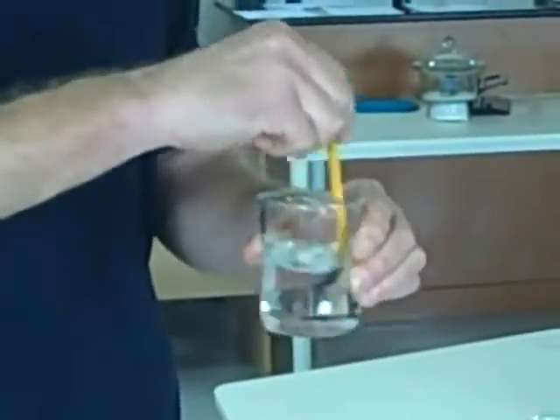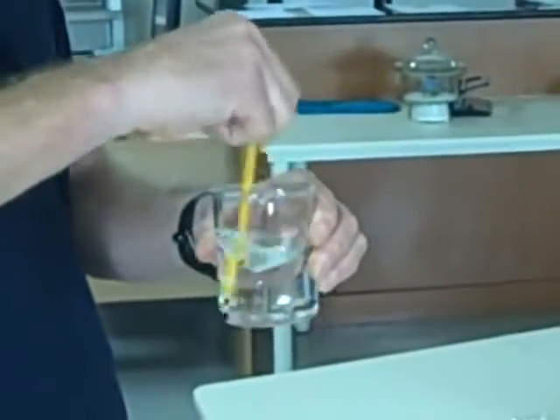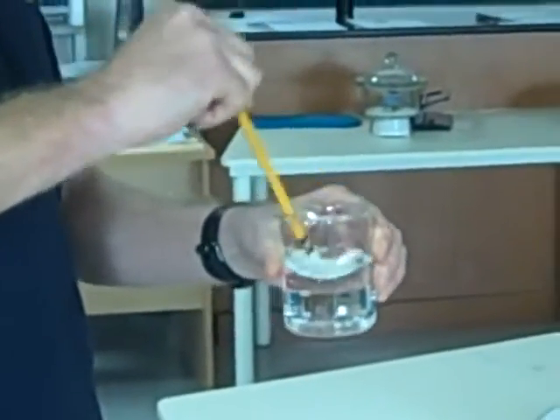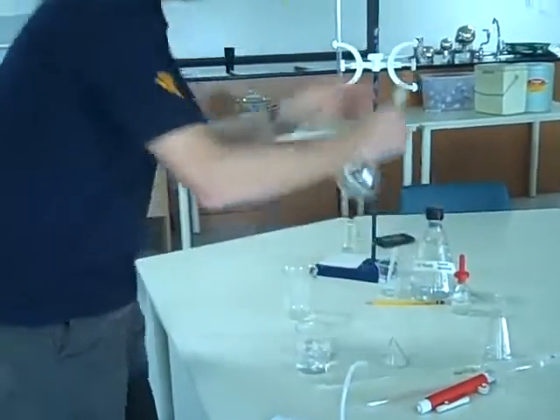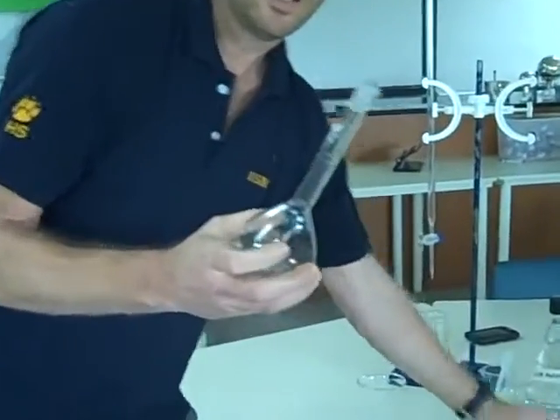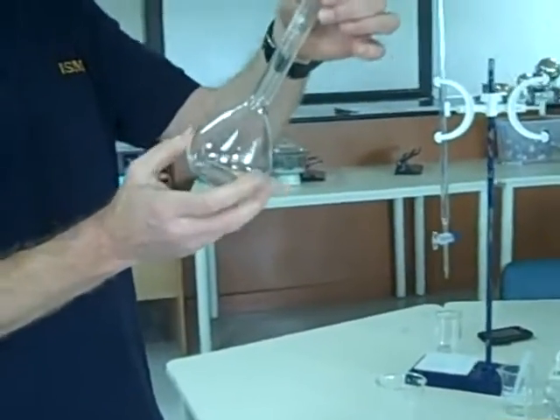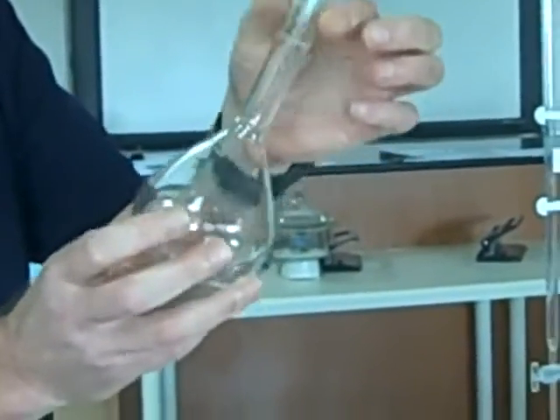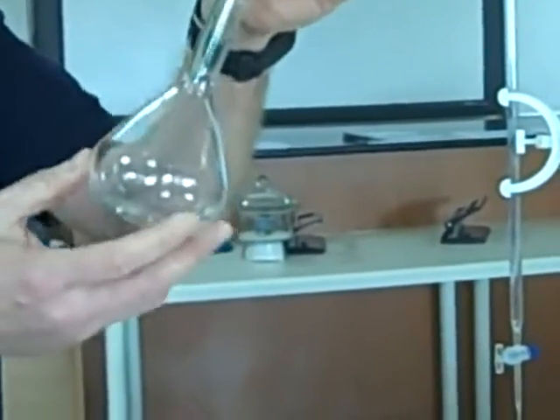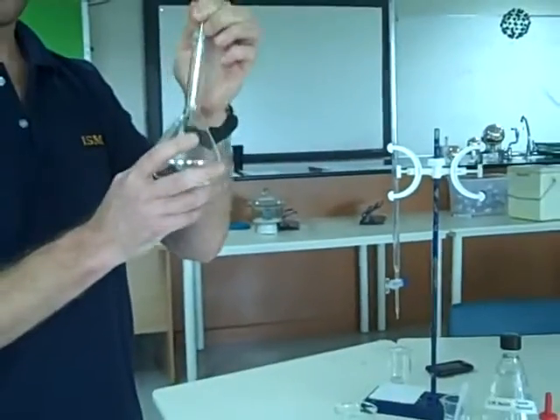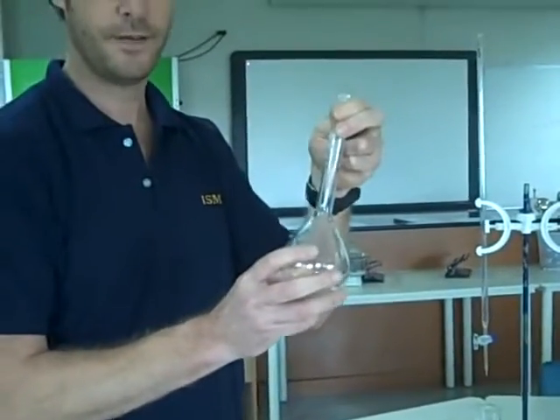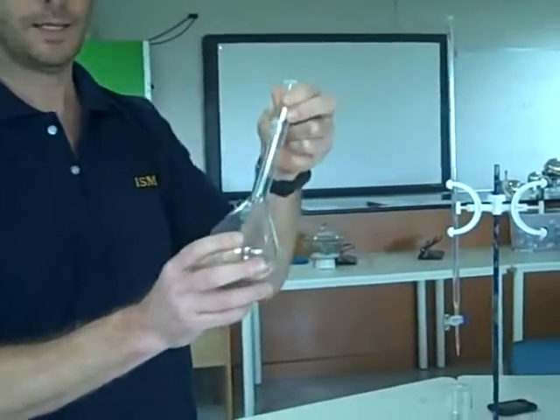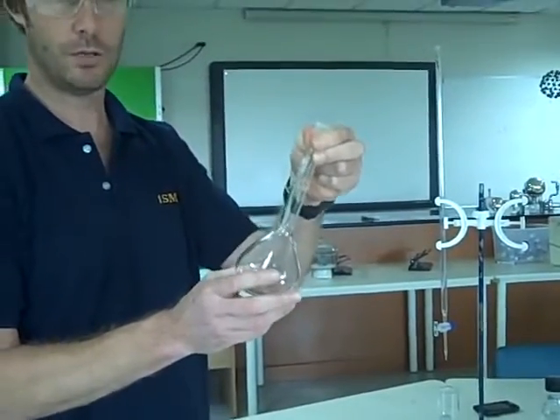That's completely dissolved. The solid is very soluble. That's my glass stirring rod. Then you take your volumetric flask. Now, these devices have a very precise and accurately known volume. This is 250 milliliters. Actually, we know that if we use this properly, we can measure 250.0 milliliters, or 250.0 cc's.